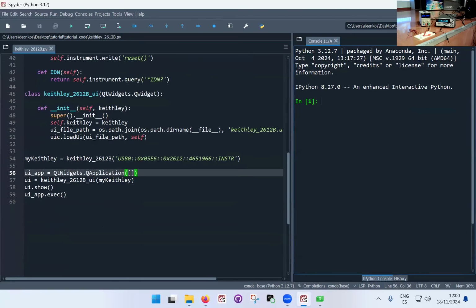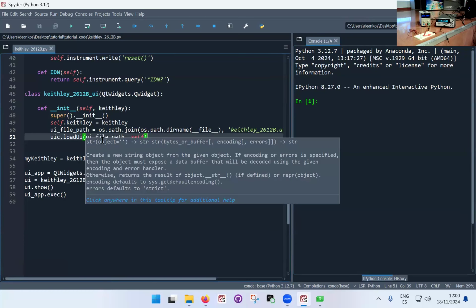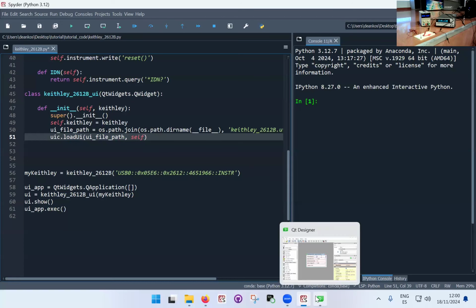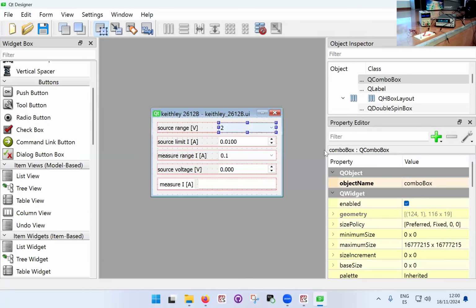So I'm gonna shut that down, and so we have the class of the widgets. So we know that it works, it opens clearly. And now we're gonna add the functionalities one at a time. Now what this load UI command does is that it takes the widgets of my user interface file and imports these widgets as objects inside of this Python class. What does this mean? It means that there is an object inside my user interface which takes the name of the object name here, which is called combo box. So to access that object inside the code, I would go for self.combobox, do something, whatever.